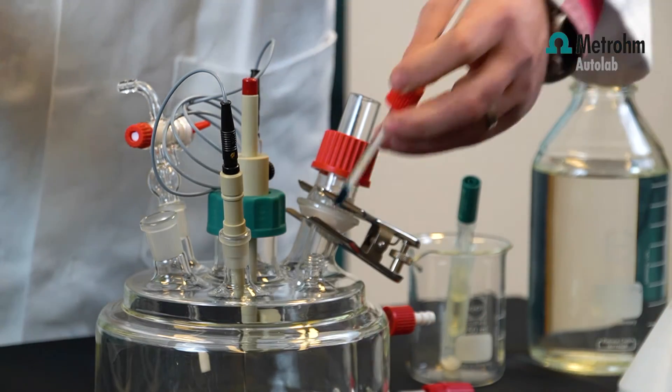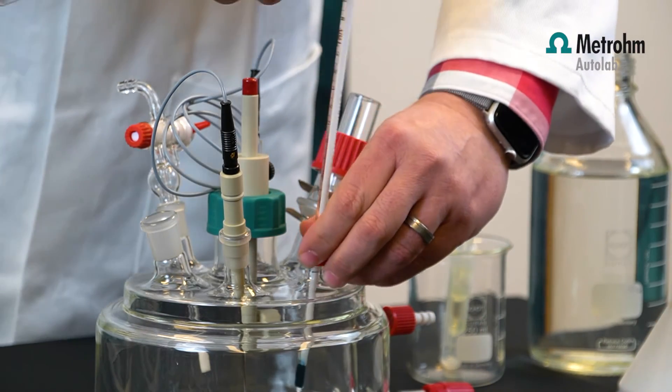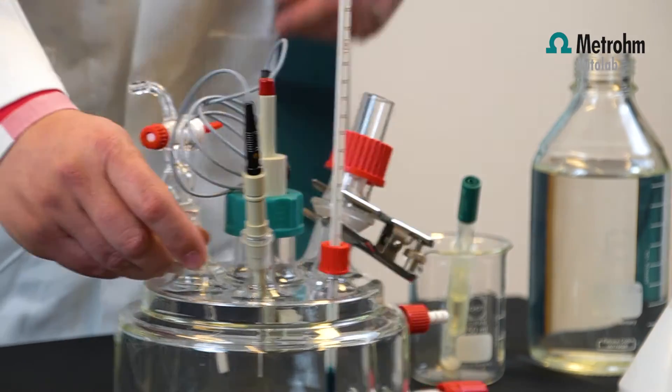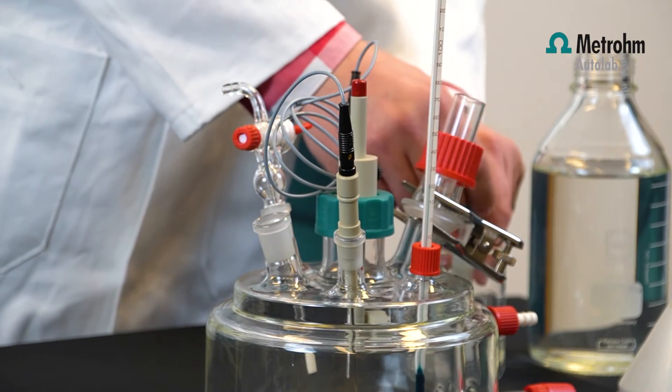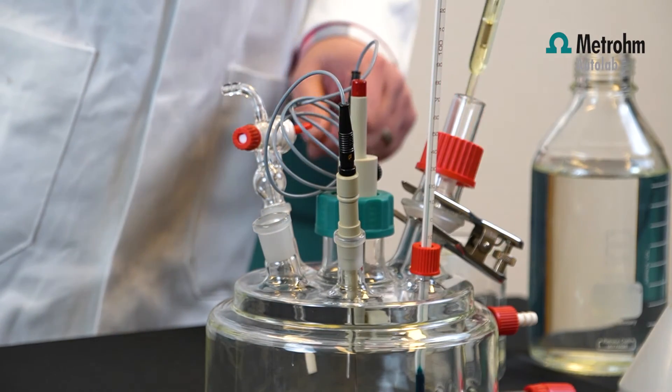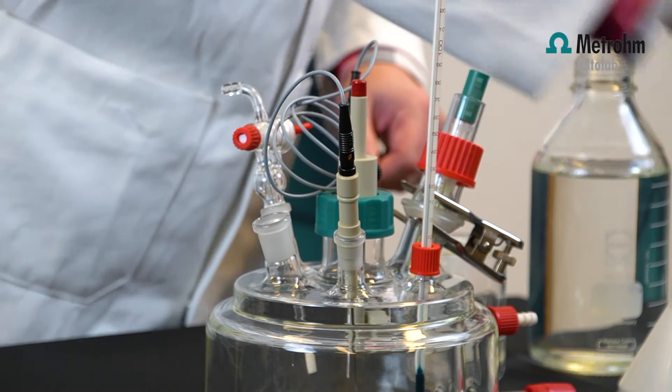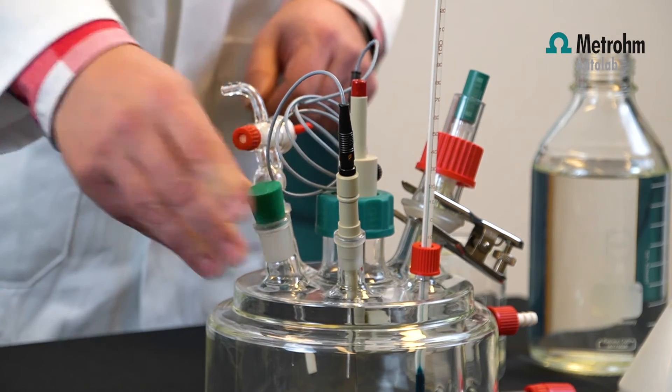Then we have our thermometer positioned here. The reference electrode goes into the Luggin capillary like this, and we have a stopper to seal it off.